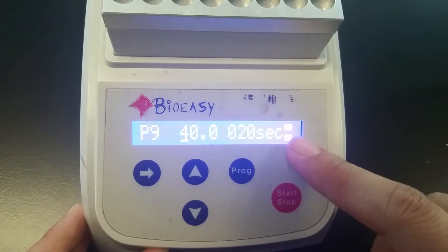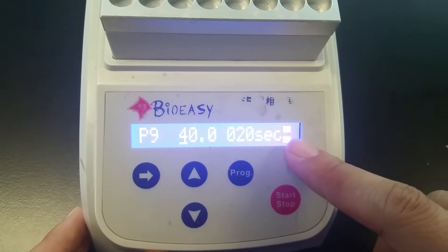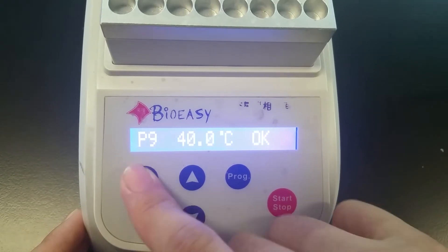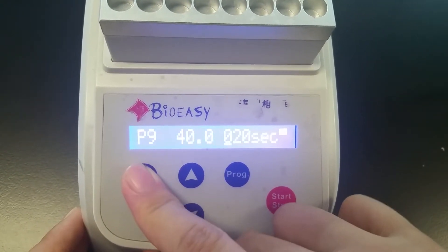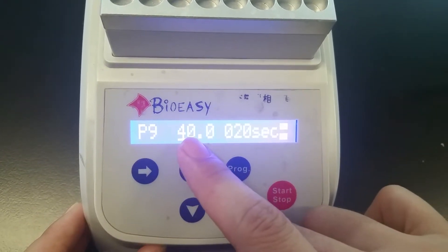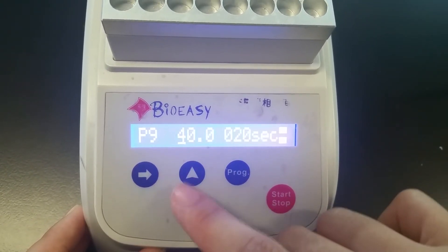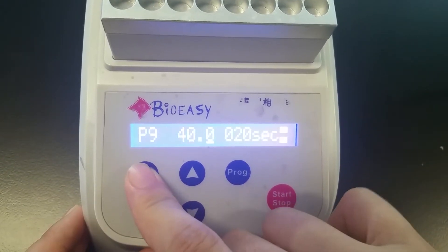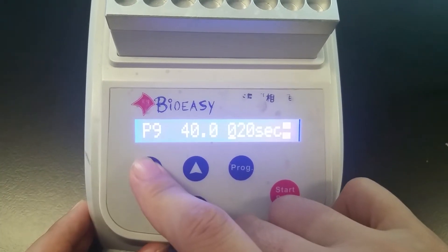So it means we can start setting the second round incubation temperature and time. So again, we can set the temperature to 40, and we can press the left button further to set the time.